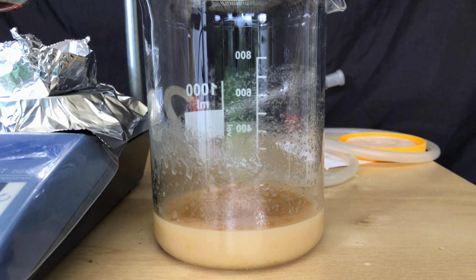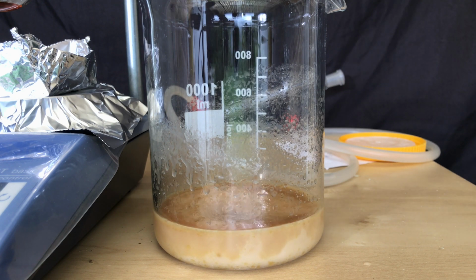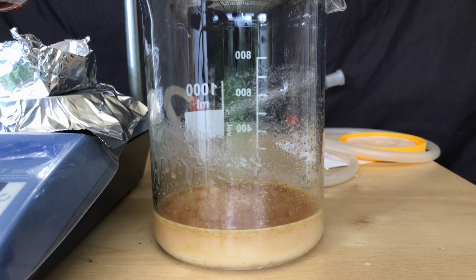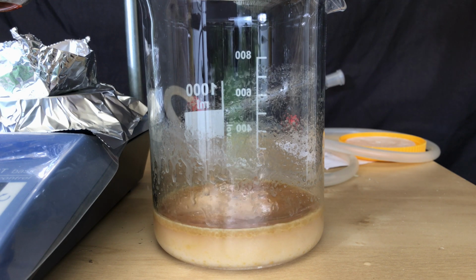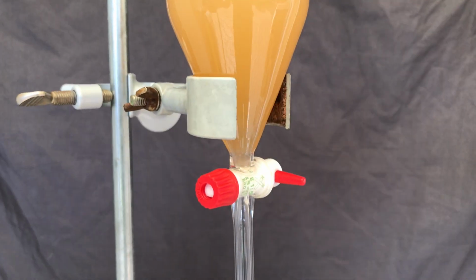This, however, didn't work. I ended up with an oil, tried to dissolve it in hydrochloric acid again to get at least some sort of product, but it stayed an oil and it failed. I am going to try this again in the future using a different method, so stay tuned.